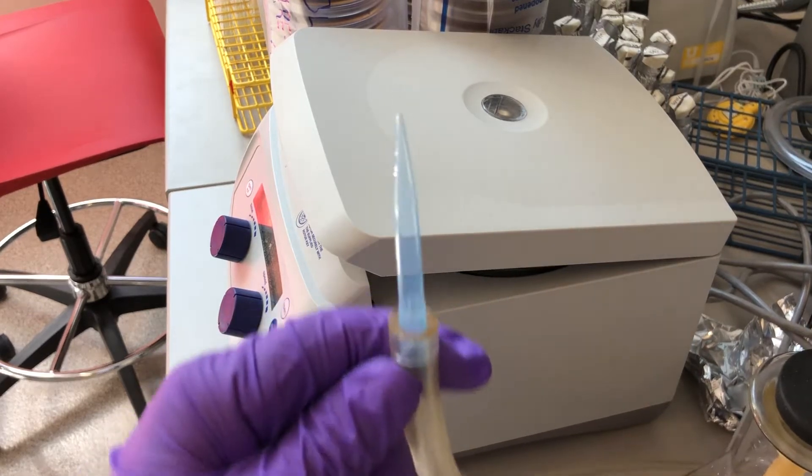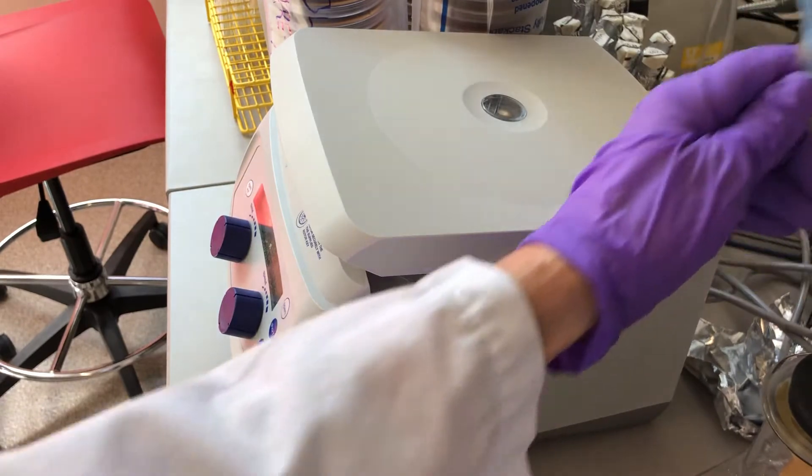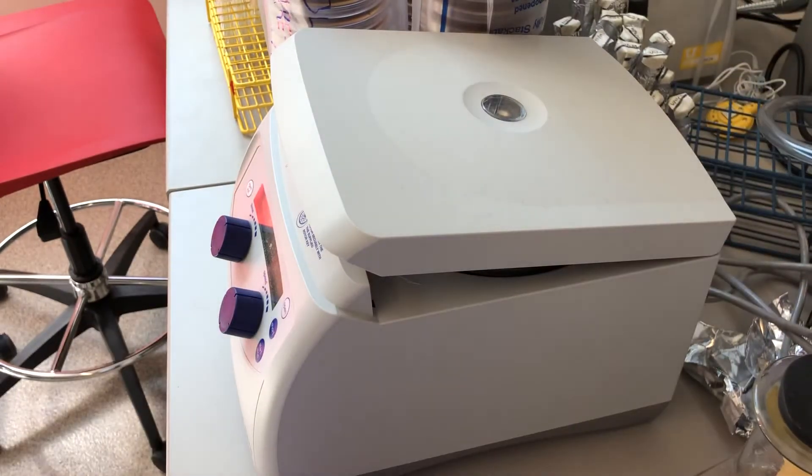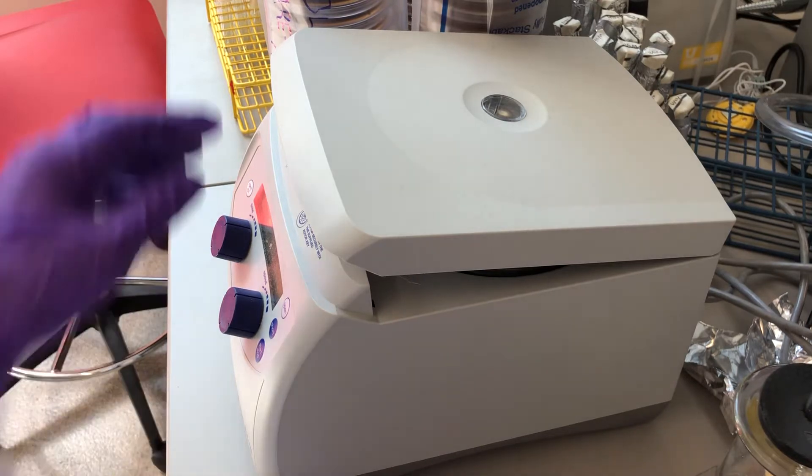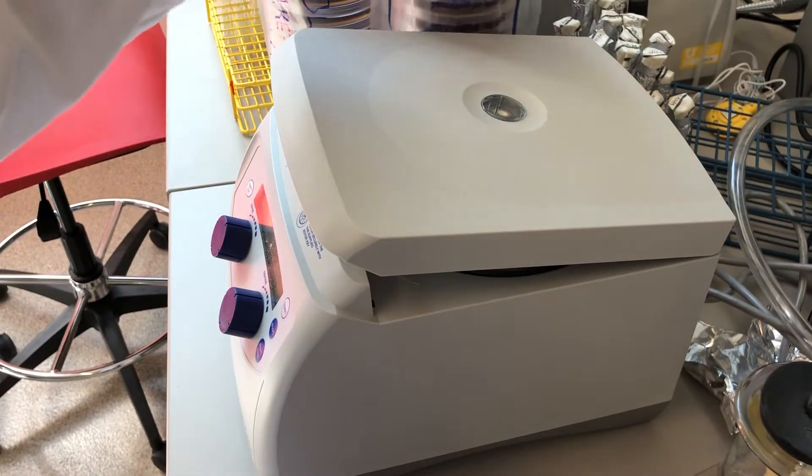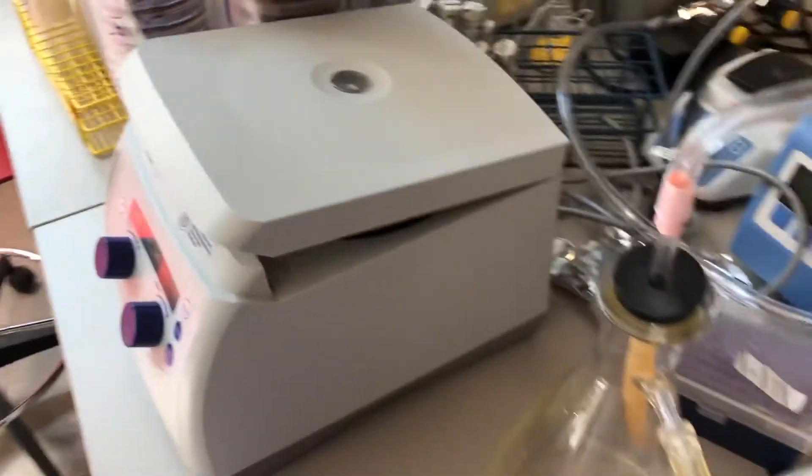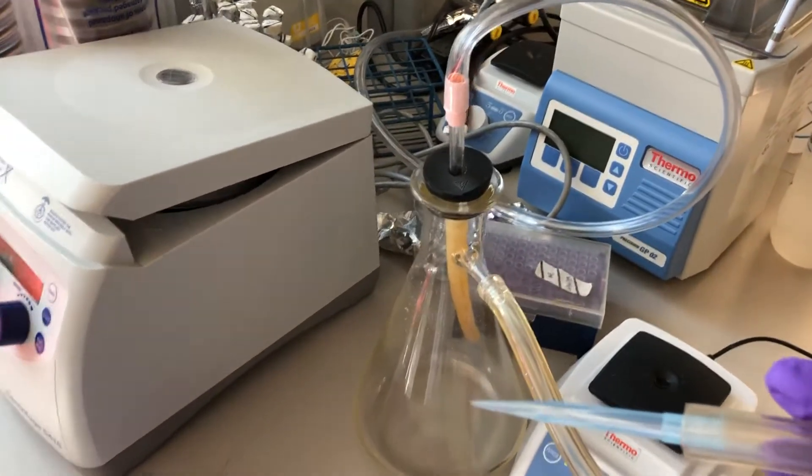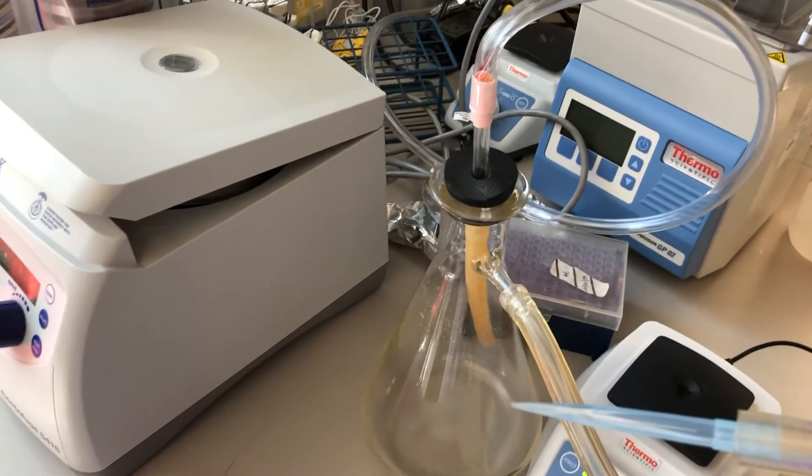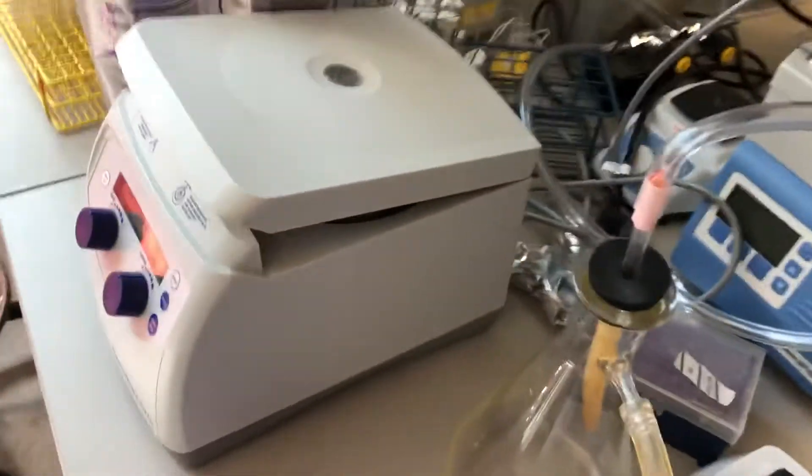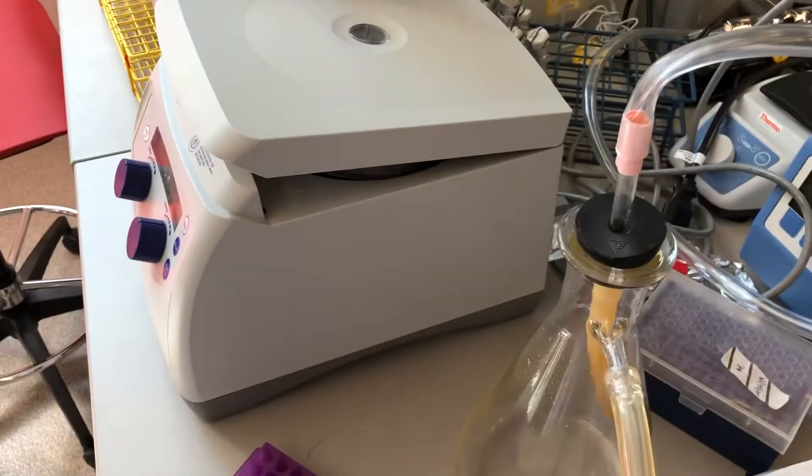Okay, harvesting cells part two. The centrifuge has finished the centrifugation and I've attached a vacuum to this apparatus that has a trap to collect the cells so we can safely remove the media.